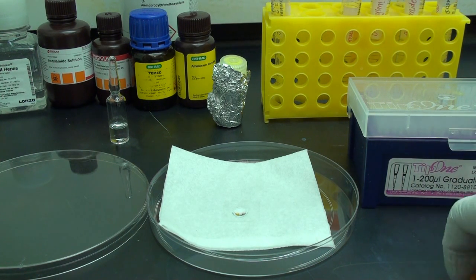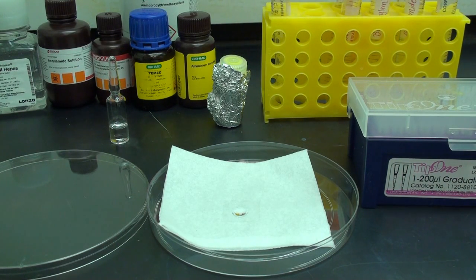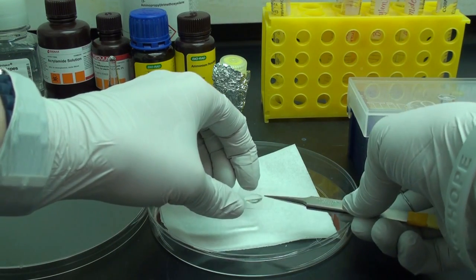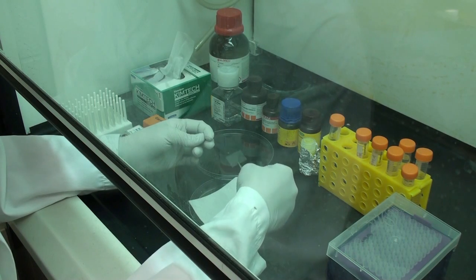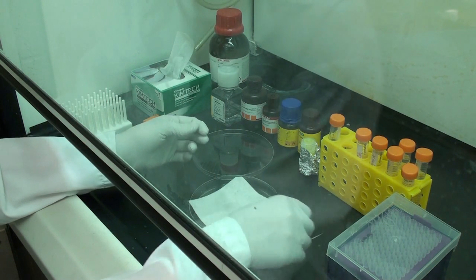We will allow the glutaraldehyde solution to remain on the glass cover slip for about 30 minutes. After 30 minutes, we will rinse it off thoroughly with DI water and dry it on a hot plate for about 15 minutes. Now the glass cover slip is activated. We are ready to make the gel solution.